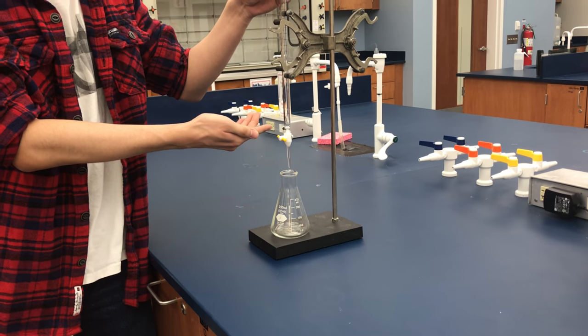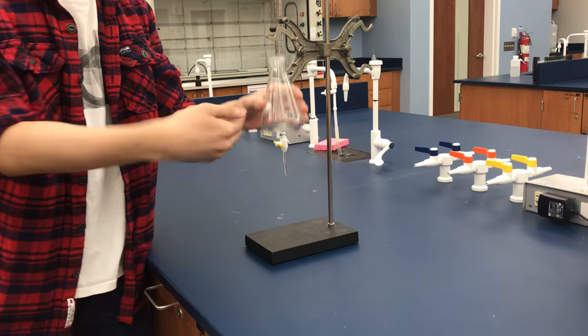Gather a burette, stand, clamp, and Erlenmeyer flask.